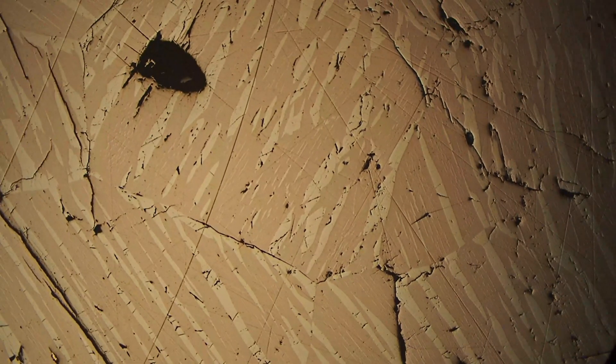As we rotate the stage we can see it's going from a darker pink into a lighter pink, and this is the bireflectance that ilmenite exhibits. Sometimes it can go as far as a pinkish brown to a darker brown, but we're just seeing a subtle effect here.